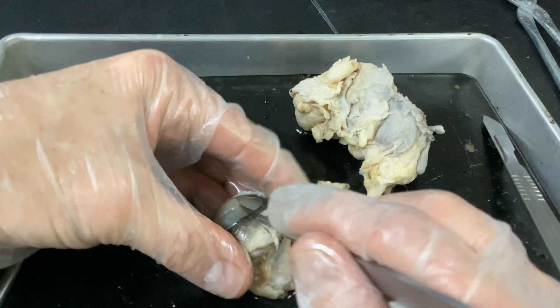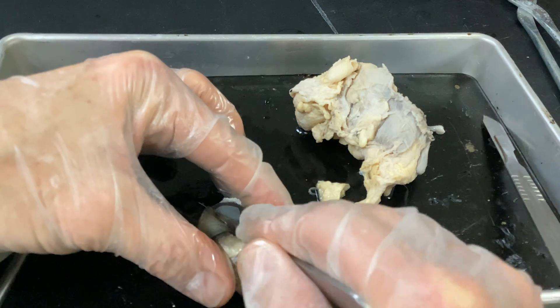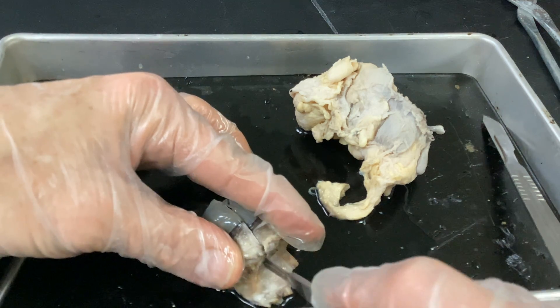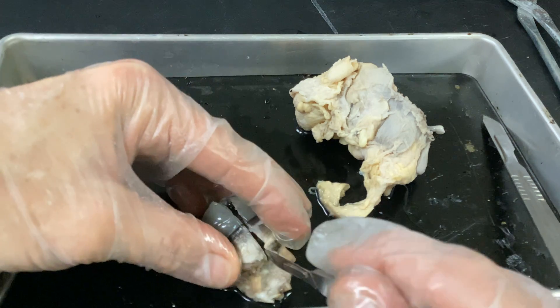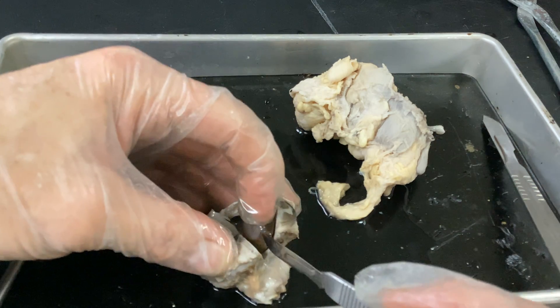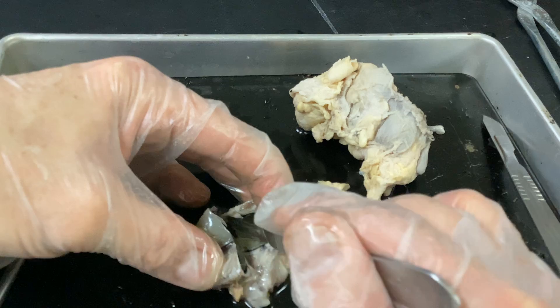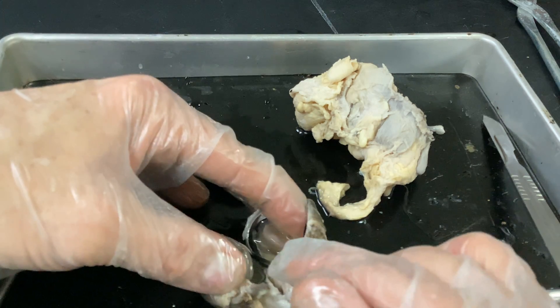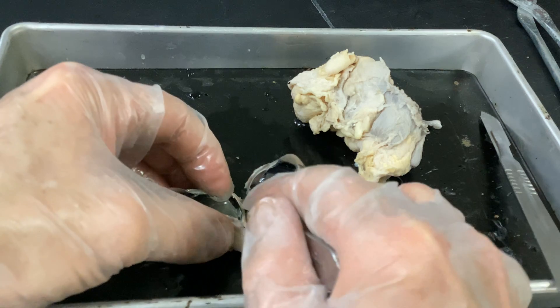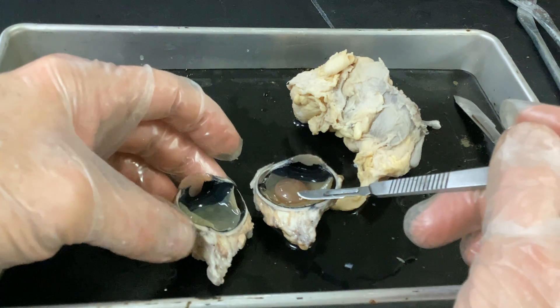All right, so I'm actually through this — I'm going to cut right through that. Remember, that cornea should be clear — it's avascular, no vascularization, so it can be transplanted relatively easily with no blood supply and really no rejection. You can see that is the crystalline lens — and it's anything but crystalline. This cow eye has been sitting in formalin forever, so it's going to absorb some of that and change. Cataracts are similar — the crystalline lens gets very dark, so they keep the capsule and go in and change the lens inside of it.